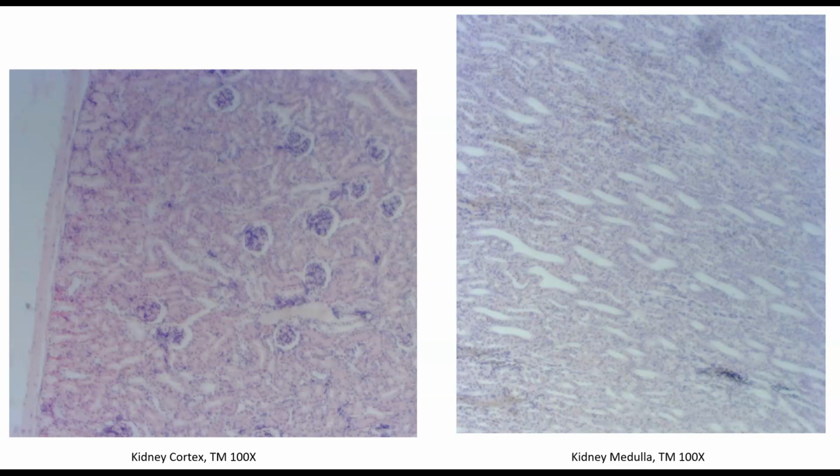In this video, we're going to look at kidney histology. You can see here, there are two views, one of the kidney's cortex, which is the outer part of it, and then one of the kidney's medulla. What we can see in the cortex are several glomeruli, which is the ball of capillaries that has come from the afferent arteriole, and that's where filtration of plasma will start to happen.